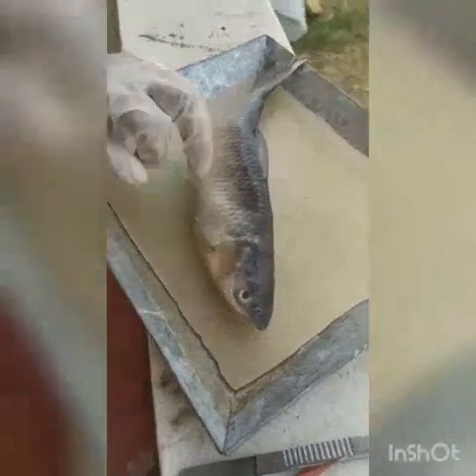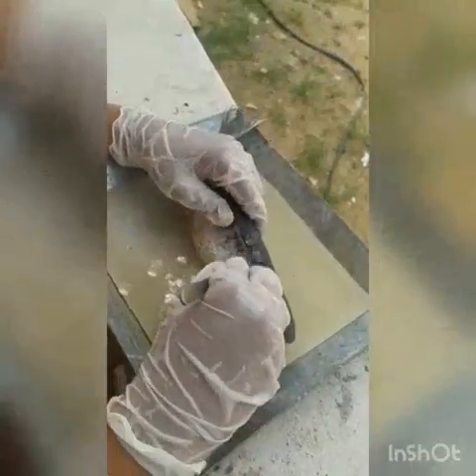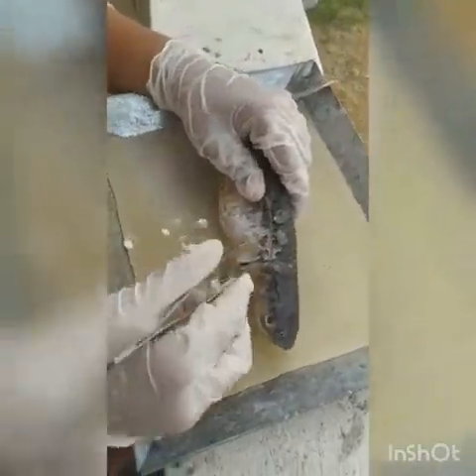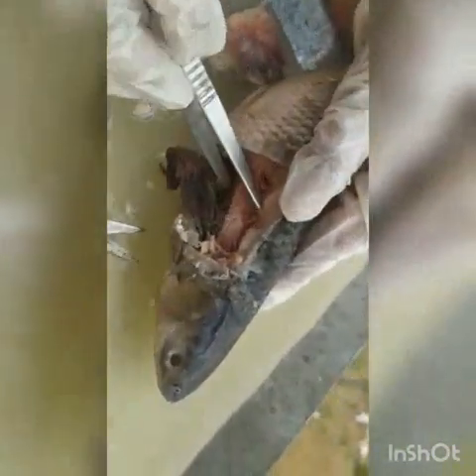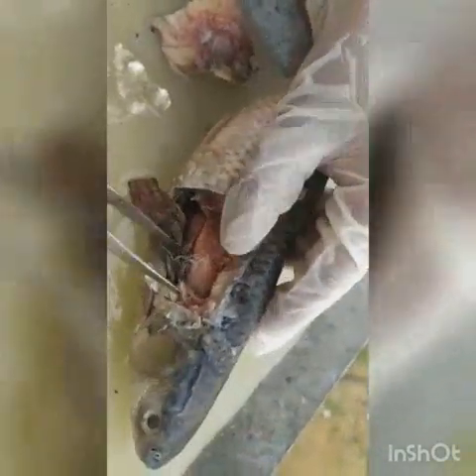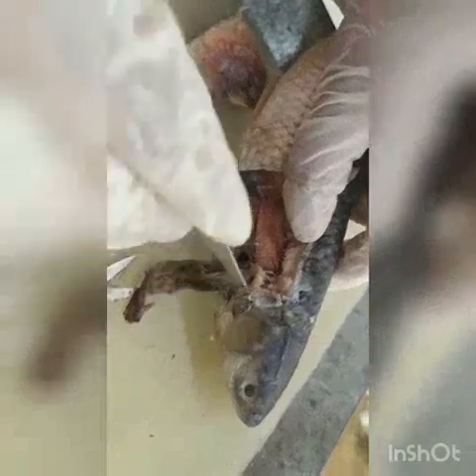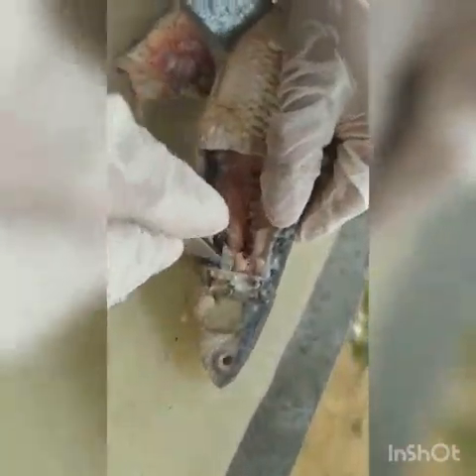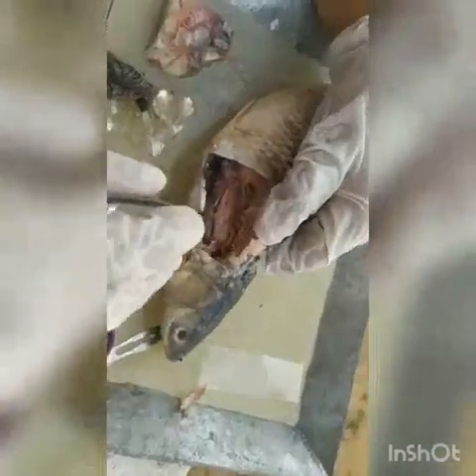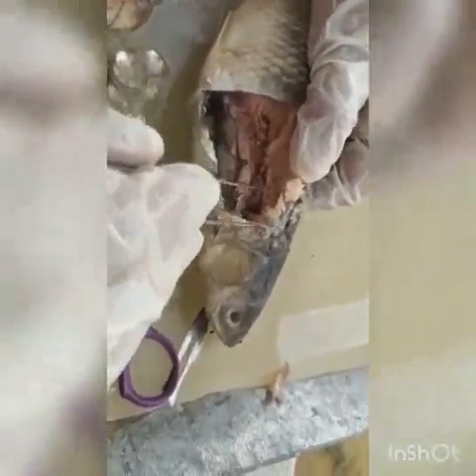Now I am going to section the fish in this region where we find the air bladder. Here we have taken the section of this part, and you can find a white colored part — this is the air bladder. Let us go into the deeper sections of this region. We can clean off the waste material and move on to the deeper layers. As discussed, the Weberian ossicles will be connected from the swim bladder to the auditory system.